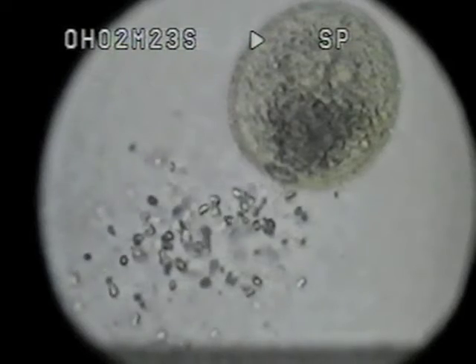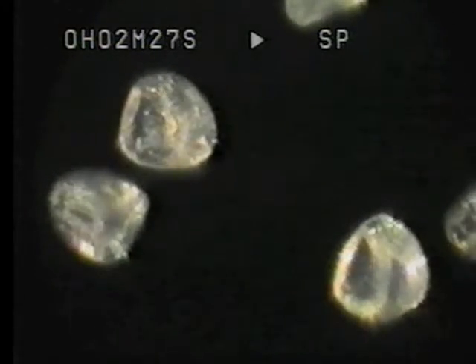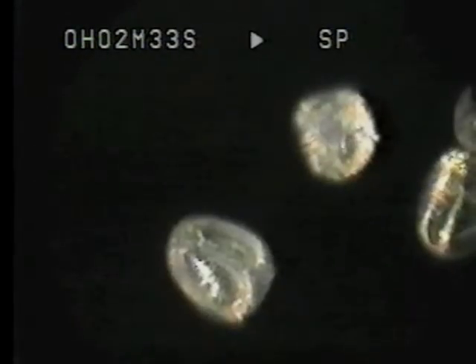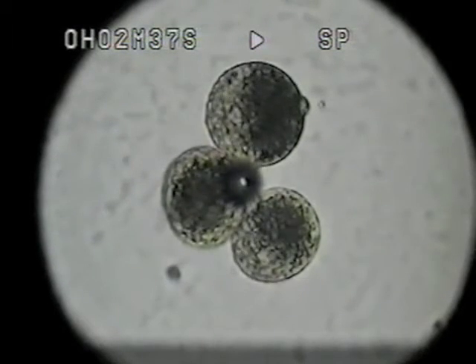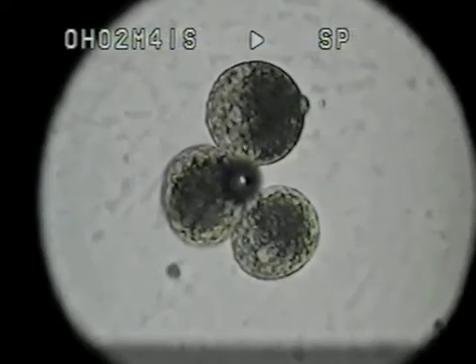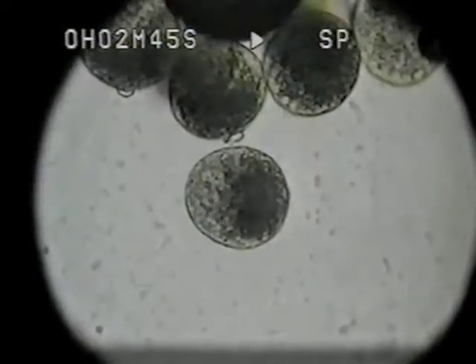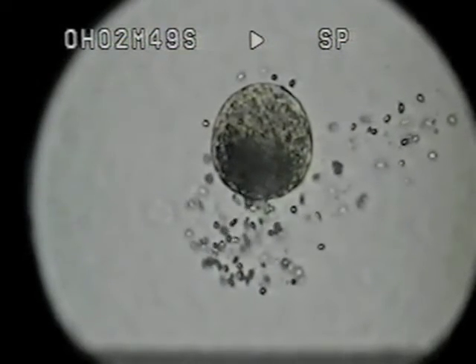Now this is Timothy grass, freshly obtained this morning. We are going to drop water on it. Now you see at 49 seconds the granules are queuing up to get out — all the same, you see. There's one — it's gone already in just about one minute.